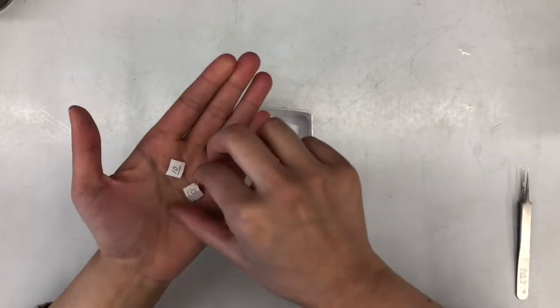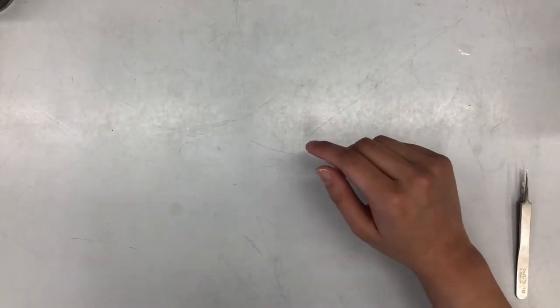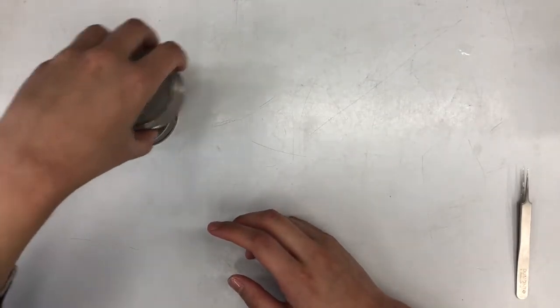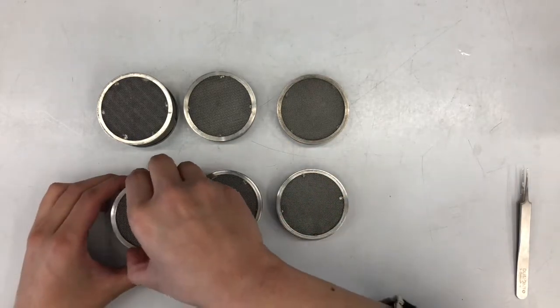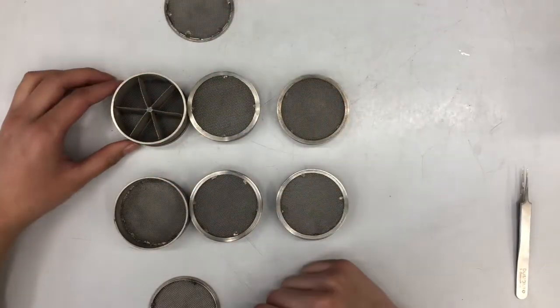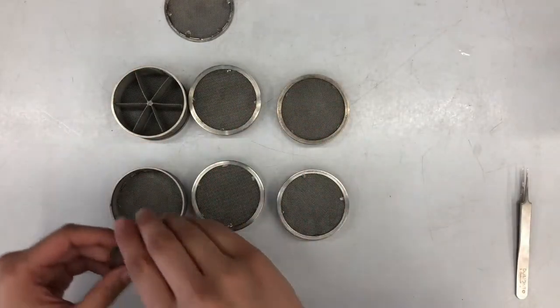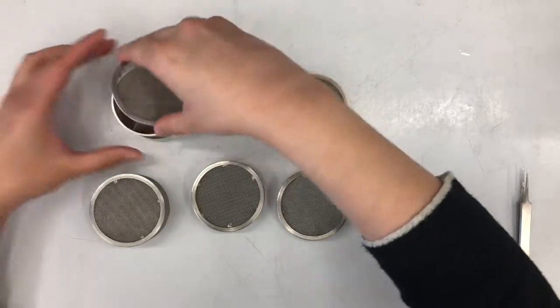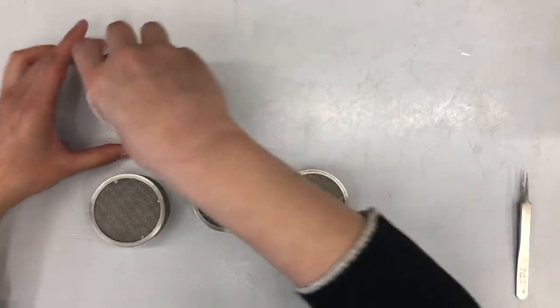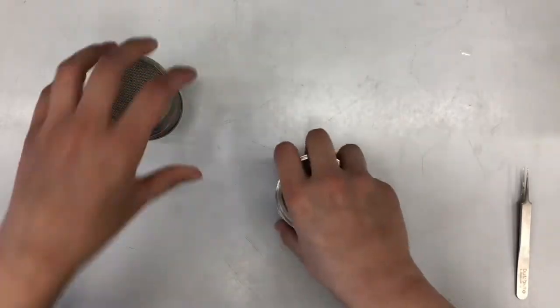You'll need two kinds of elastics - a thinner one and one that's a little bit thicker. I also have a couple of jars filled with 100% alcohol that I use for the second soak. And you're going to need these little white labels that I've made myself from paper - you can see here I have two matching ones, like two tens, and you want to make a couple of these.